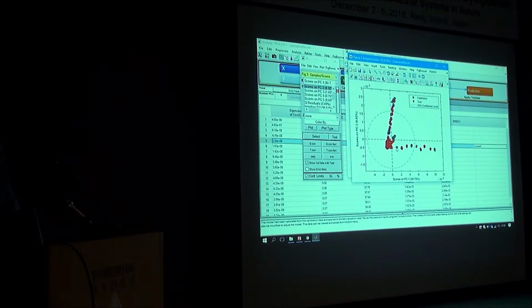And if you apply a KNN model on these, when you get close to 0, you can also do a very successful identification. But what I did, I used the full spectral range. I didn't use principal component analysis because I think there are additional dimensions that are important for identification of samples. So it's a simplification of a more complicated task, but hopefully it gives you some idea what can be done with this data.